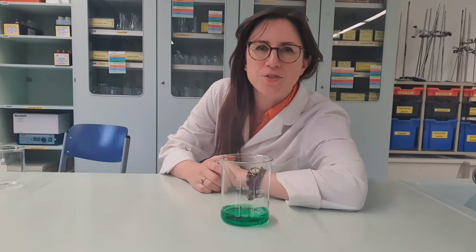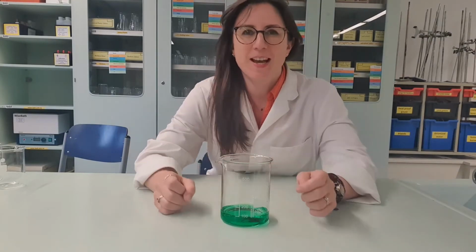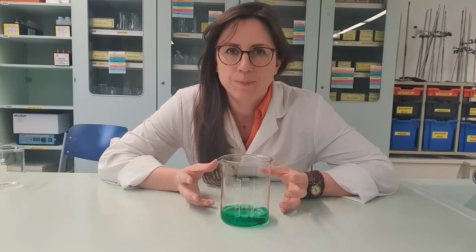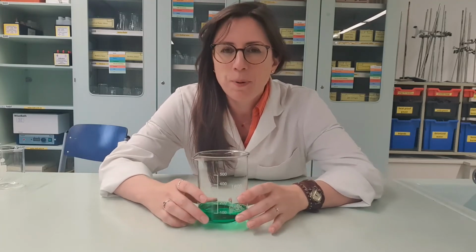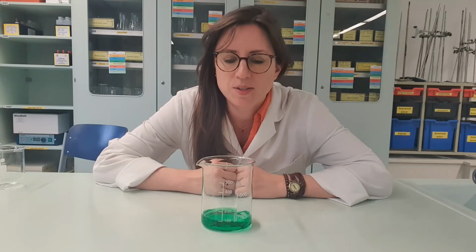Are you measuring your volumes precisely in science? Well, let's put it to the test. So sometimes I'll ask students to measure me out 100 milliliters of a volume of a particular liquid. And they will pick a beaker to do that job. But in fact, a beaker is not a measuring device for volumes of liquids.